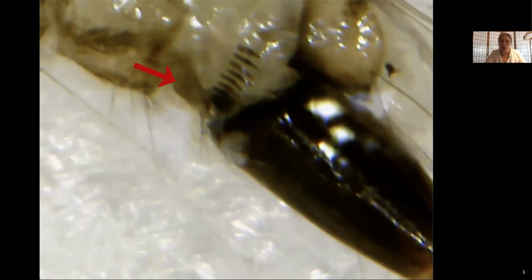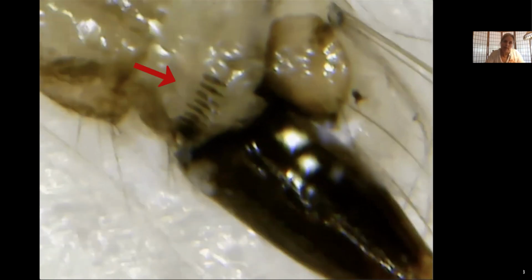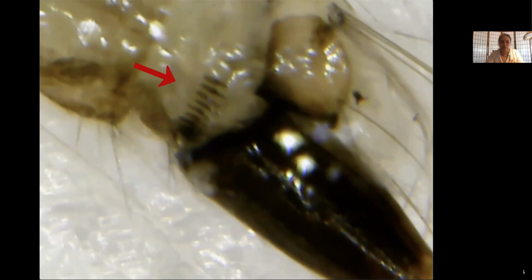But what we see, which is absolutely beautifully displayed in this view, are the things called the comb scales. You'll see those right at the top of the siphon. There is a row of 1, 2, 3, 4, 5, 6, 7. You can see 7 of them. There's probably 11 or 12 of those guys, but you can see them really clearly.